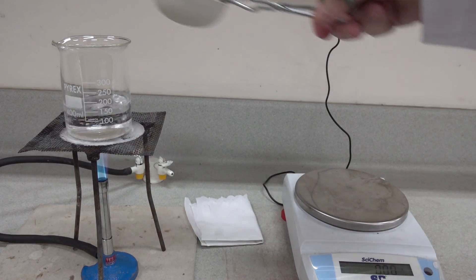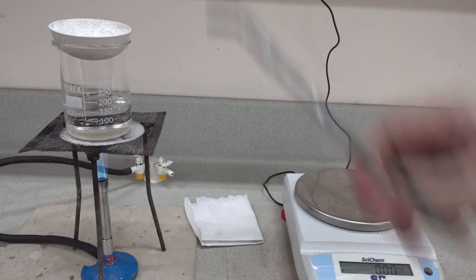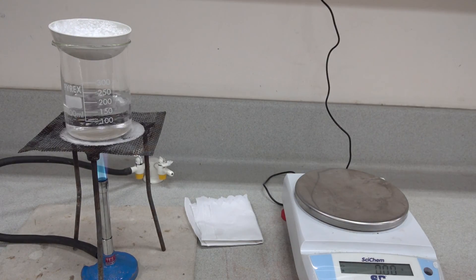And we'll return to the water bath to evaporate through again and make sure that we've got constant mass.